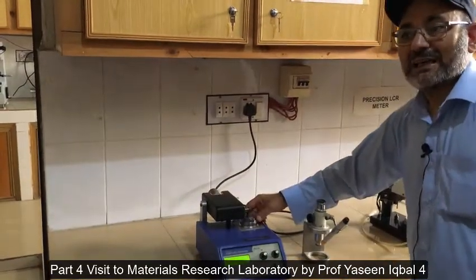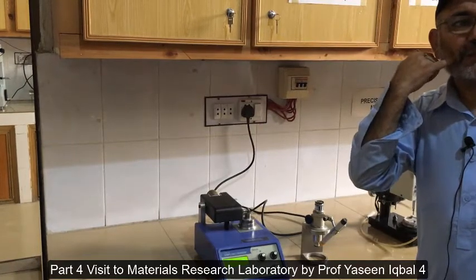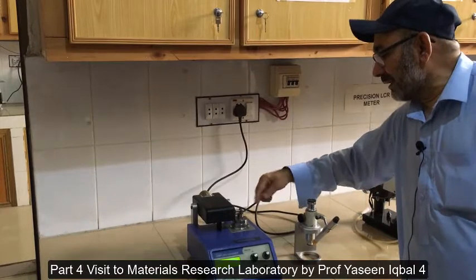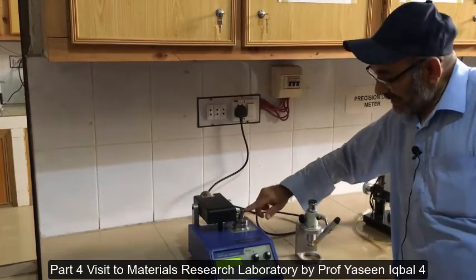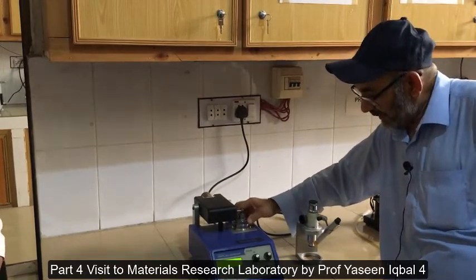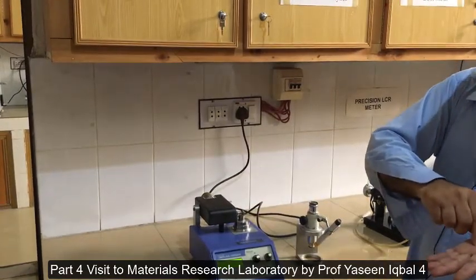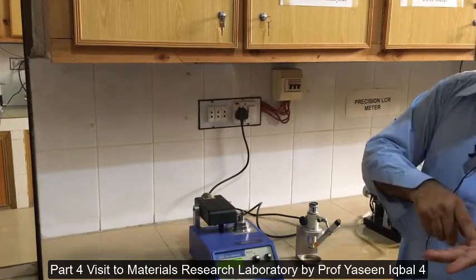This is called a dimpling machine. You put the 100 micrometer thick sample on this place, and this part moves around horizontally while this wheel runs vertically. What happens is that in the middle it creates a dimple. When that dimple reaches 25 micrometers thickness, the sample is suitable for argon ion thinning.